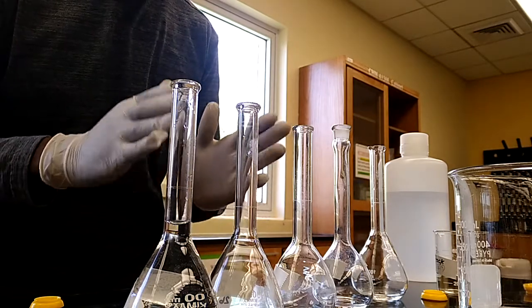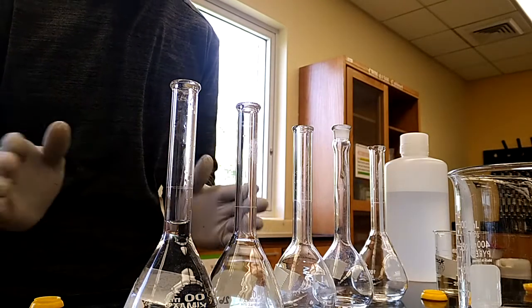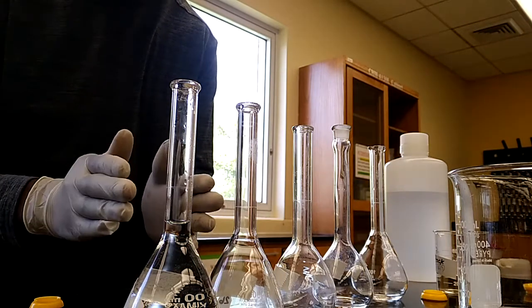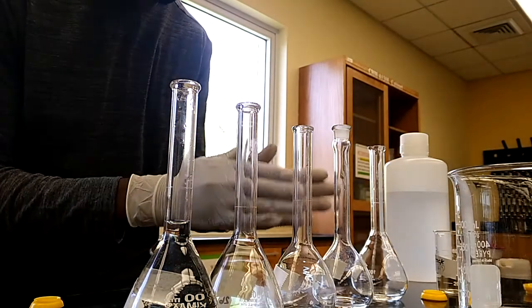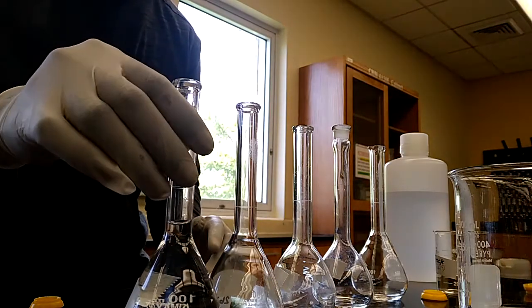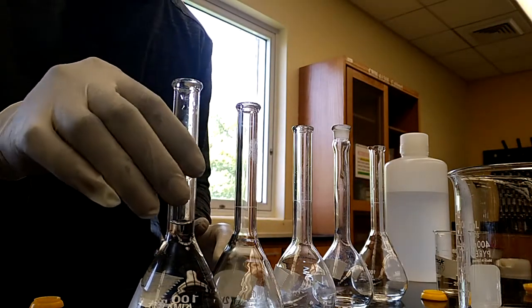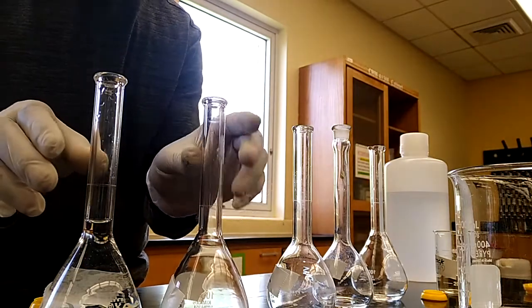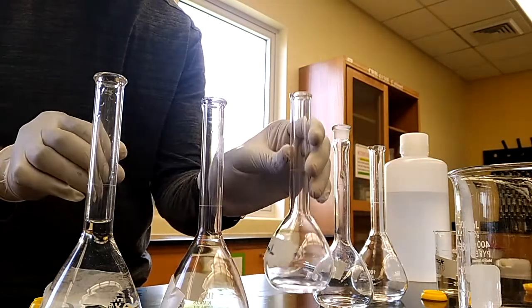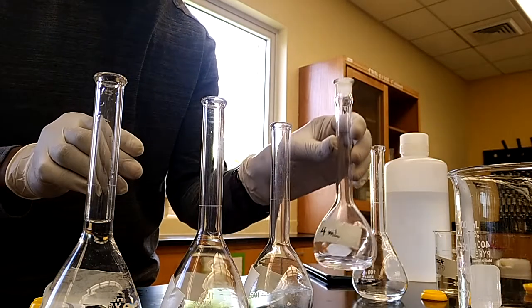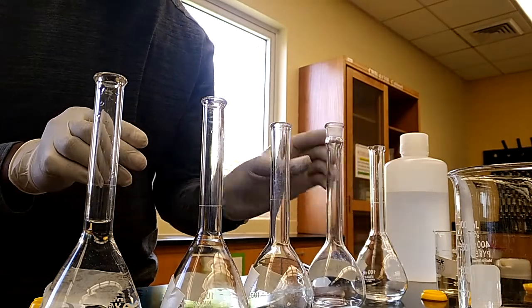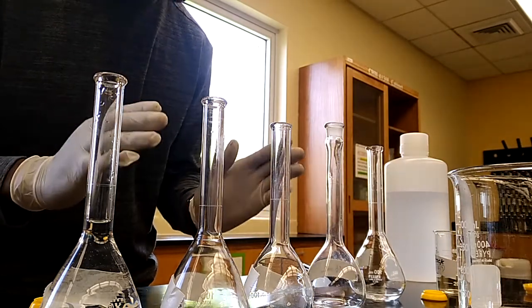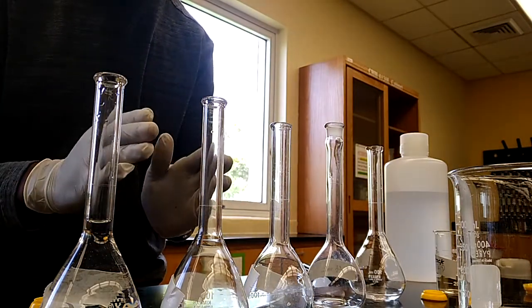To prepare the calibration standards, I have transferred appropriate volumes of the stock solution into each of these volumetric flasks. The first one contains 1 ml of stock solution, the second one contains 2 ml, the third one 3 ml, the fourth one 4 ml, and the last one contains 5 ml of stock solution. The next thing is to make up each of these volumetric flasks to the mark.